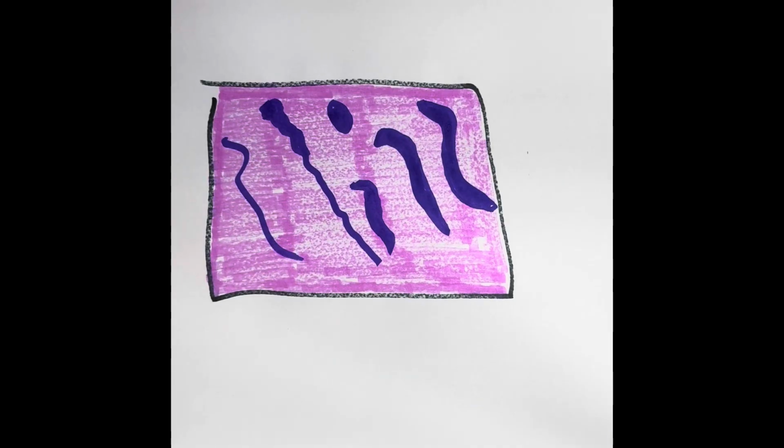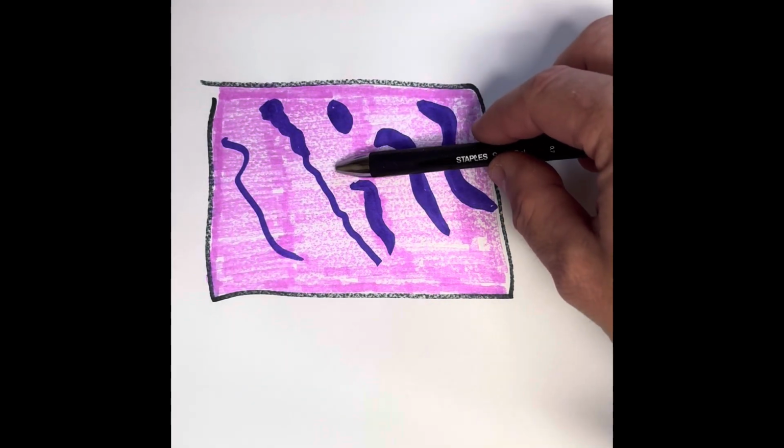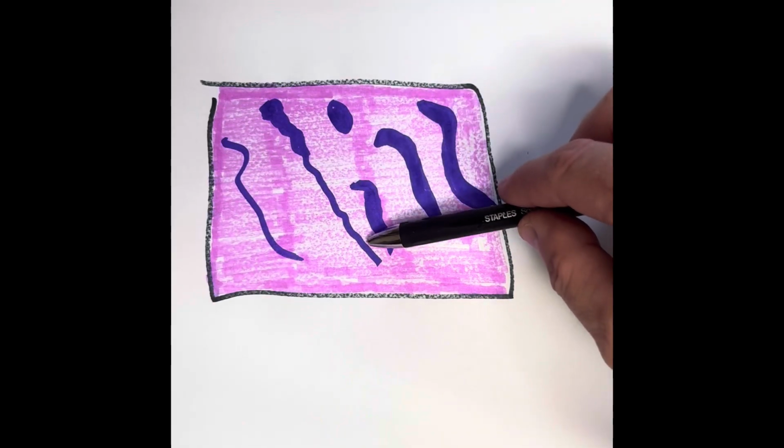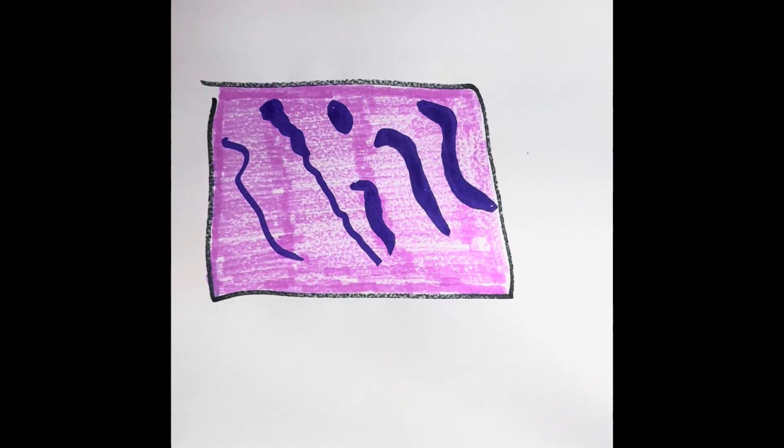This is another cartilage connective tissue. This is fibrocartilage. Fibrocartilage has rough collagen fibers. They are rough, which makes them stronger than all of the other fibers.